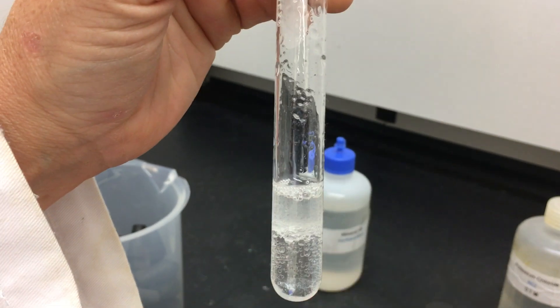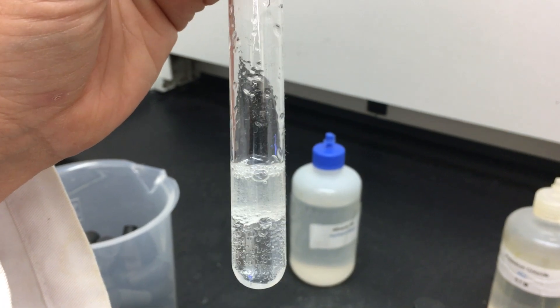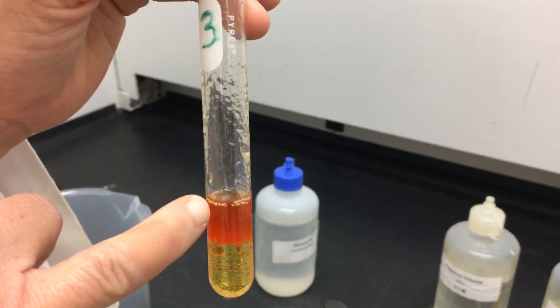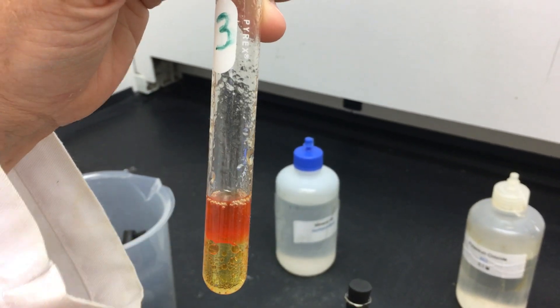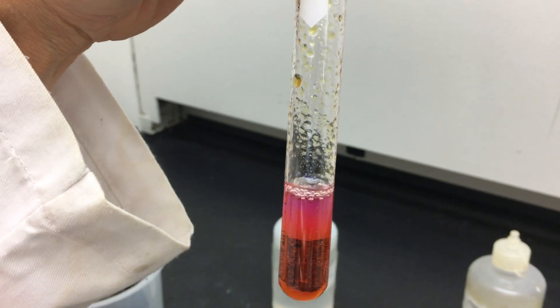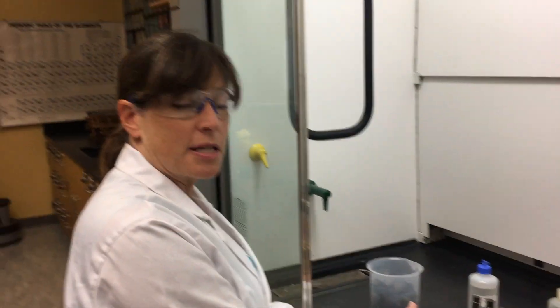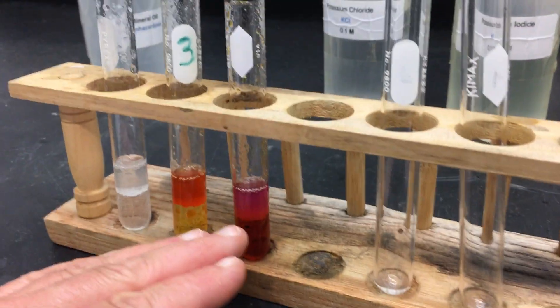In our first test tube, we can start to see those two layers being formed. The top layer is the chlorine in the oil — its color is kind of a clearish, yellowish color. Our bromine — notice the top layer is very orange. The bromine is being extracted from the aqueous layer and pulled up into the oil layer. And our last one, the iodine — notice you're starting to see a purple color in the top layer. This is the characteristic color for iodine. So chlorine is that very light, clearish yellow; bromine is orange; and iodine is a purple color.